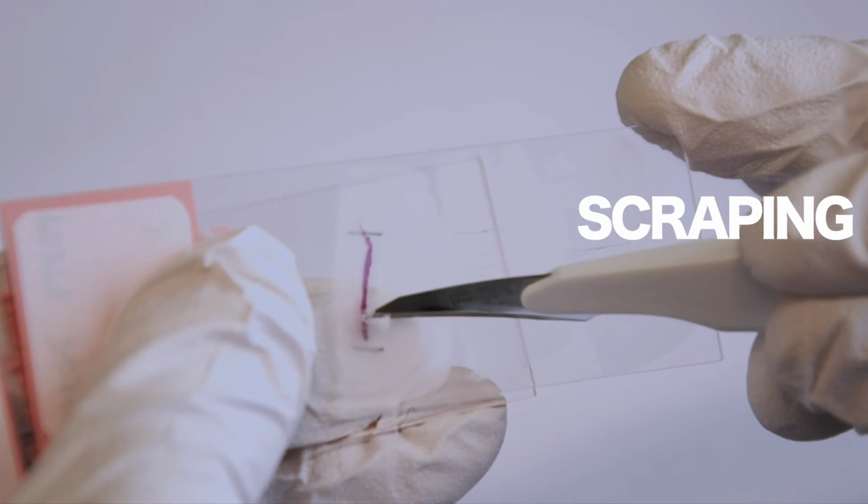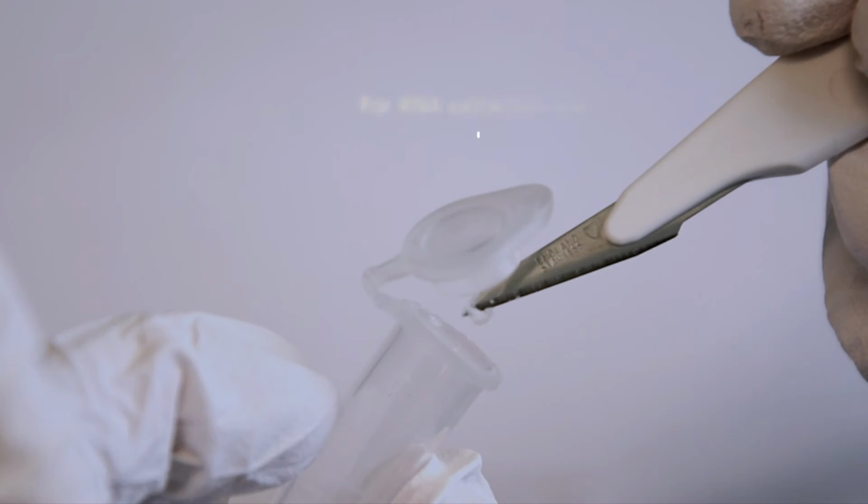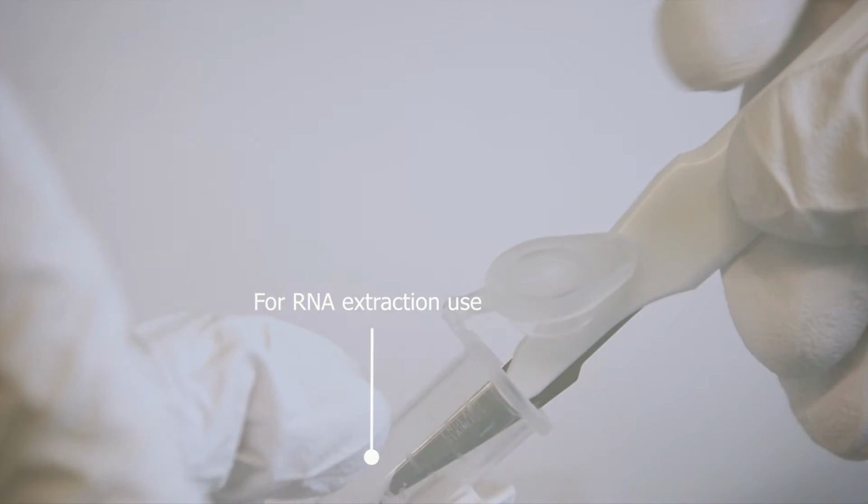Scraping. The target region containing cancer cells are taken out. This will be the raw material for the RNA extraction step.